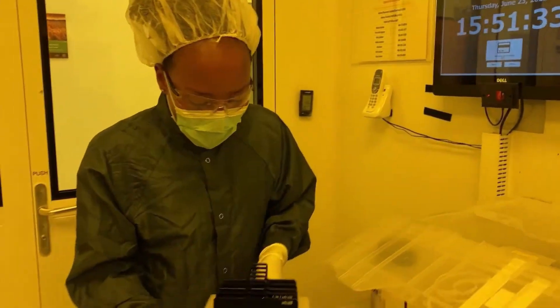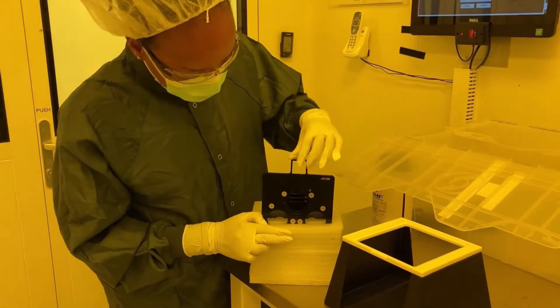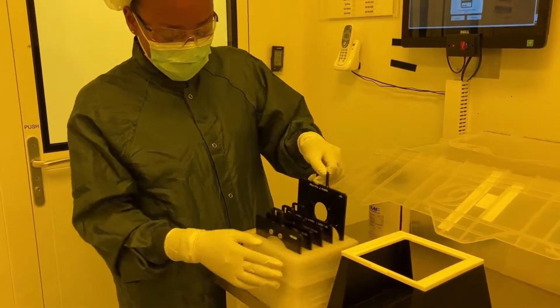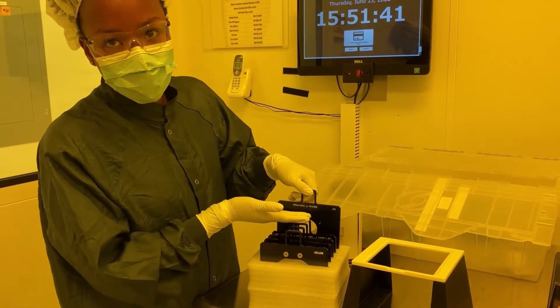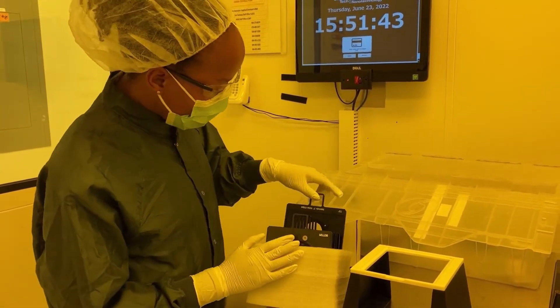Now you can see the carrier that holds the different substrate holders. The holders are what you are going to put your sample on which will then go into the Nanoscribe. They are all labeled with their name and which side is top and bottom.